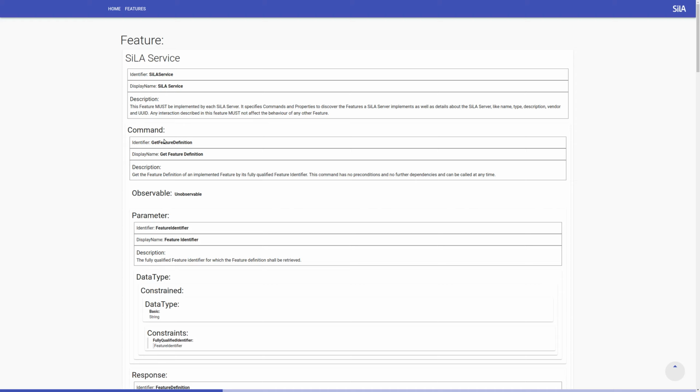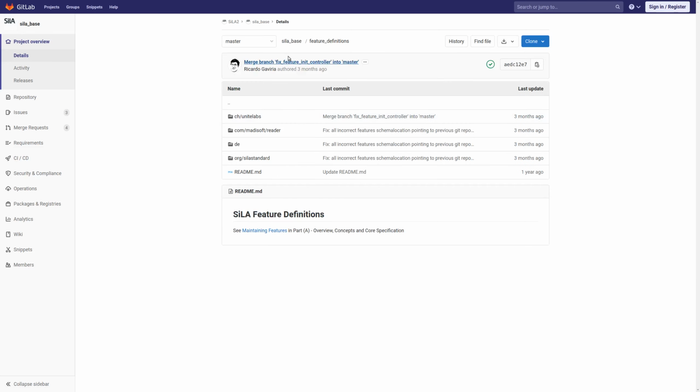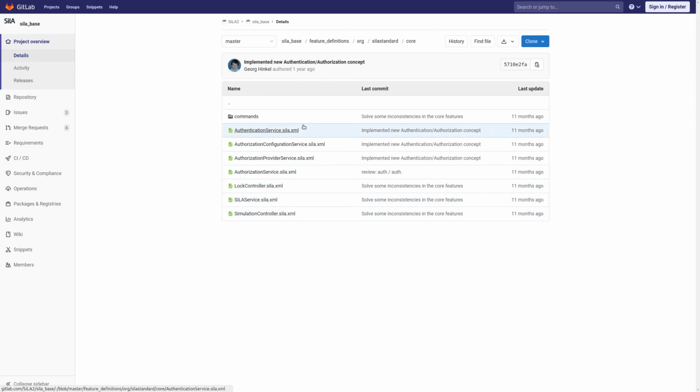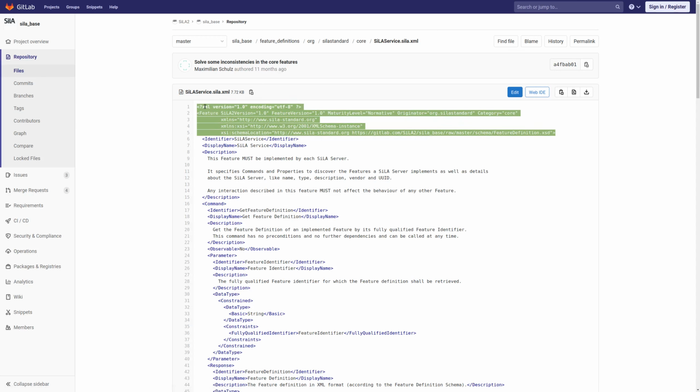And what we need first of all is the head of this file. To go there, just go to our feature definitions on SiLA base, then sila-standard.org, and then the core features can be found in this folder here. There's the SiLA service feature, and if you click on it, you need this part here, the head of this XML file.